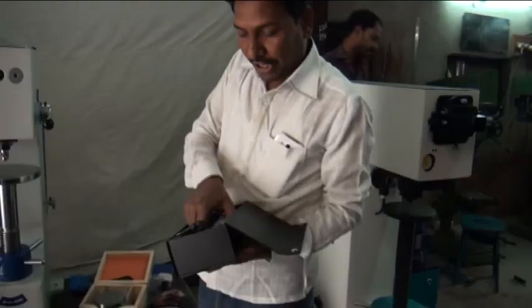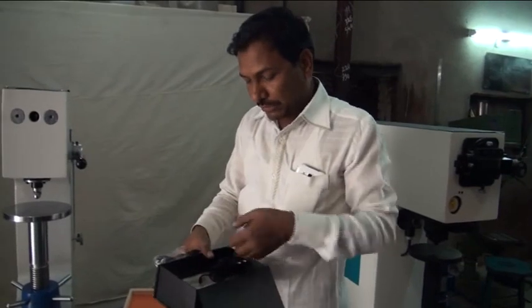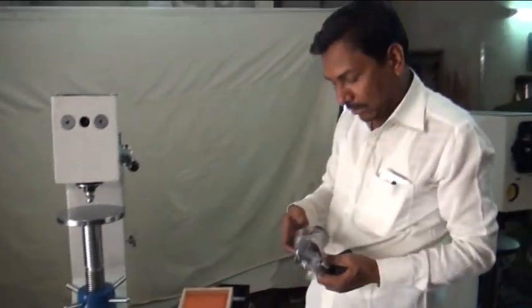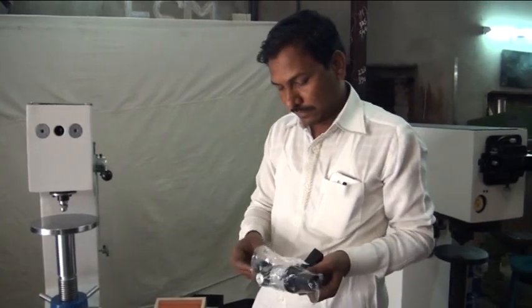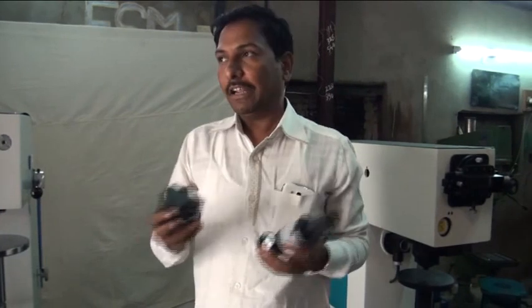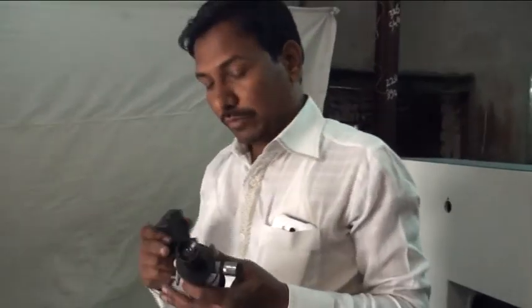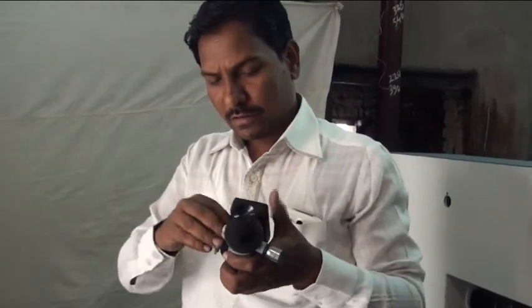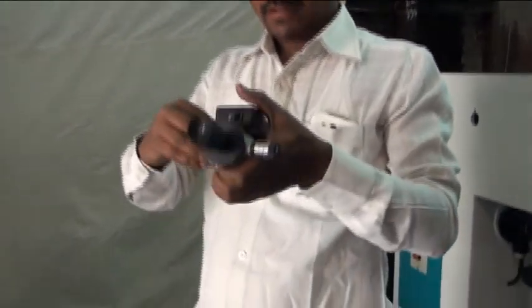Then we are giving you the microscope here. You just take the microscope and set the microscope like that one. This is the light for the specimen. If there is some darkness occurring, then you just keep here. You just fix the light here.